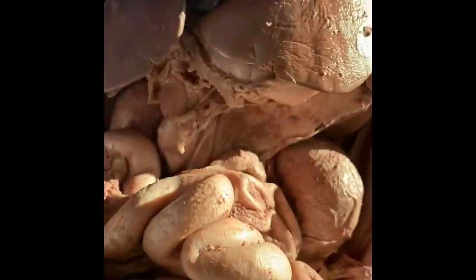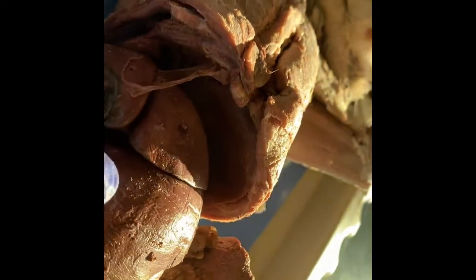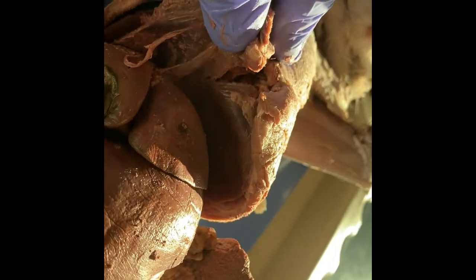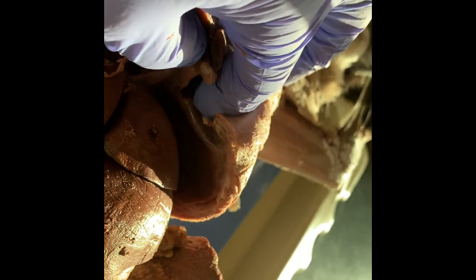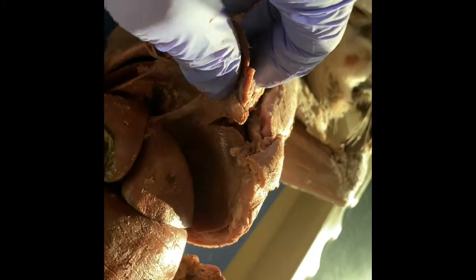It has a segmented appearance, kind of off-white, and I don't know if this light is actually helping or making it worse. Okay, so if we look inside the interior, we can see the diaphragm. This is the muscular wall. It creates a boundary between the thoracic and the abdominal cavities, and it's used in breathing. It creates a negative pressure in the chest. When you take a deep breath, it stretches down, and when you exhale, it pushes up and forces the air out of your thoracic cavity and lungs. So it's there to create pressure, okay?